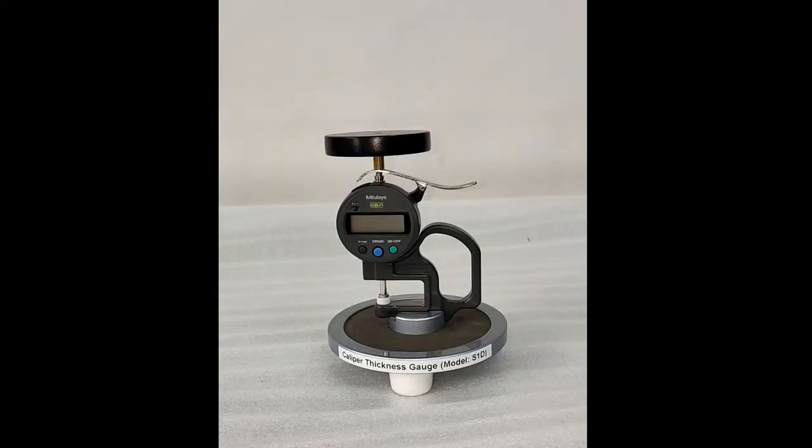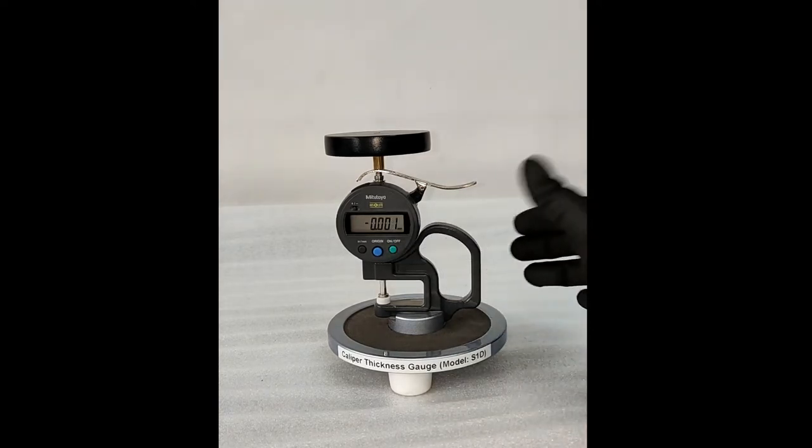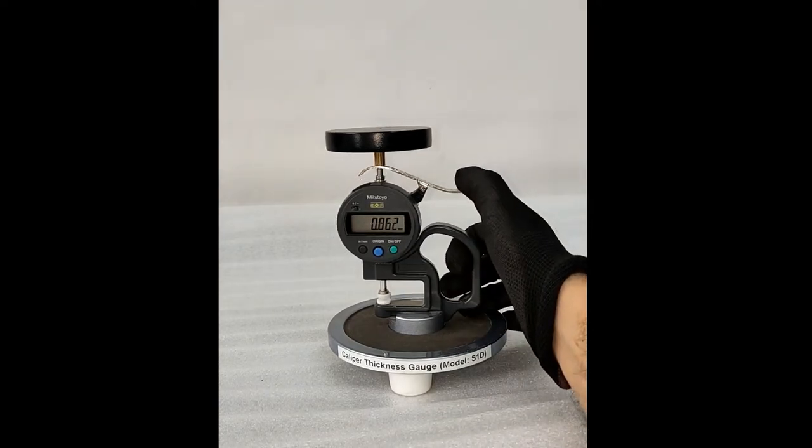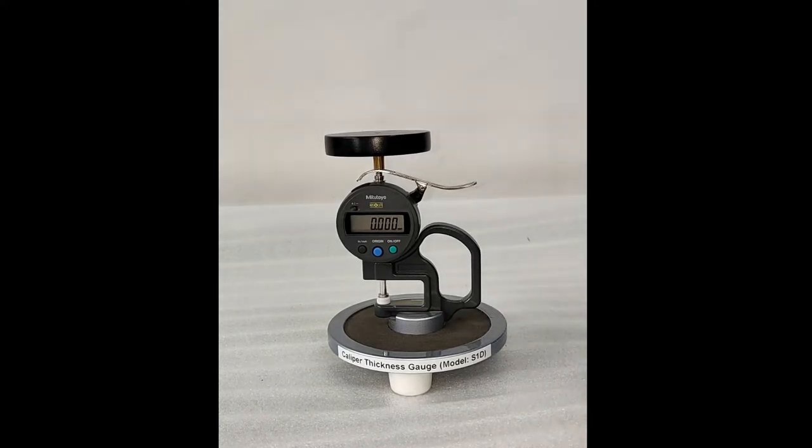Press the on button to turn on the instrument. Press the lifting lever one or two times and slowly release it. If the instrument does not show zero, press the origin button to make it zero.